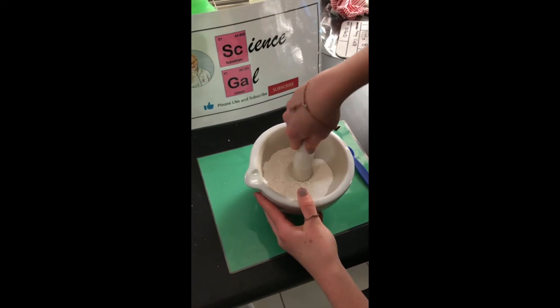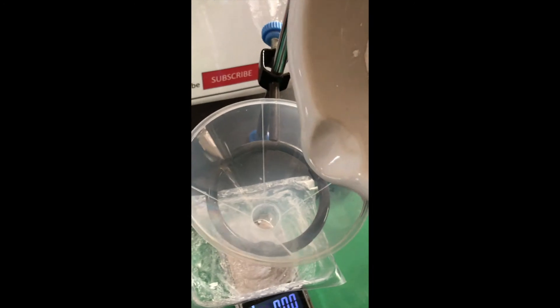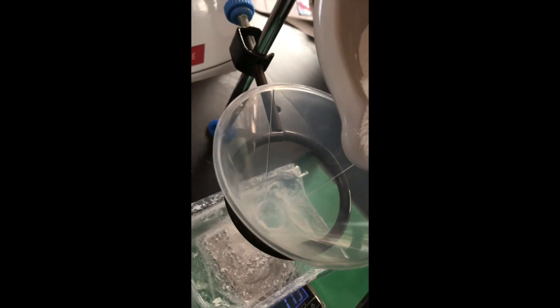Gently crush until powder. Gently pour into the scales, remembering to press tare. Pour slowly to minimize dust.